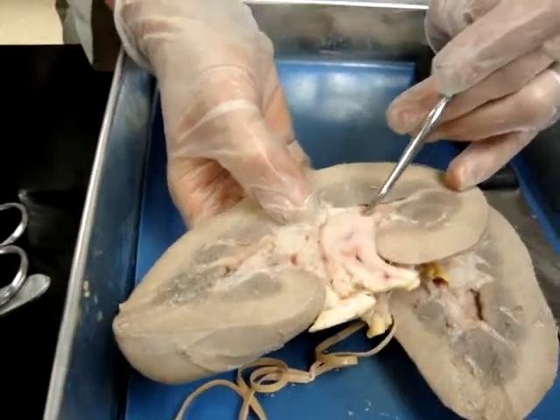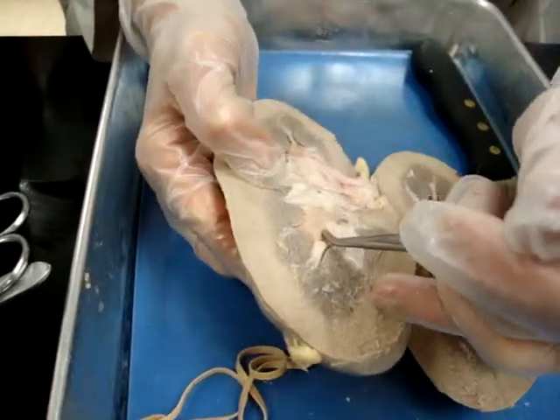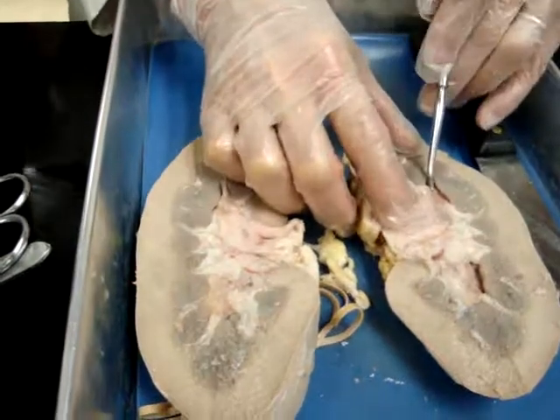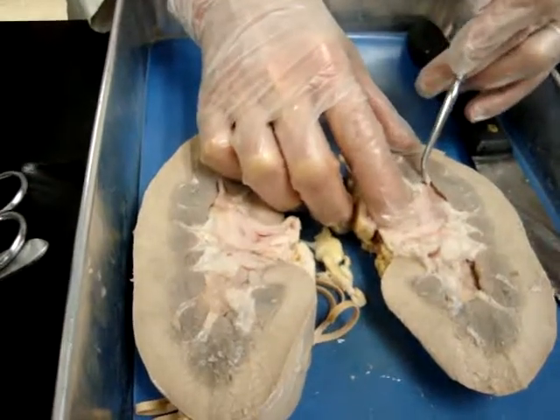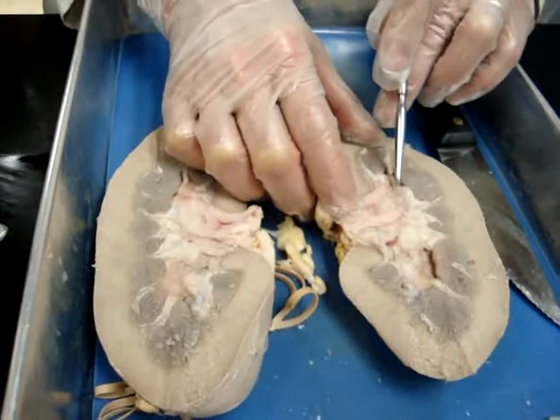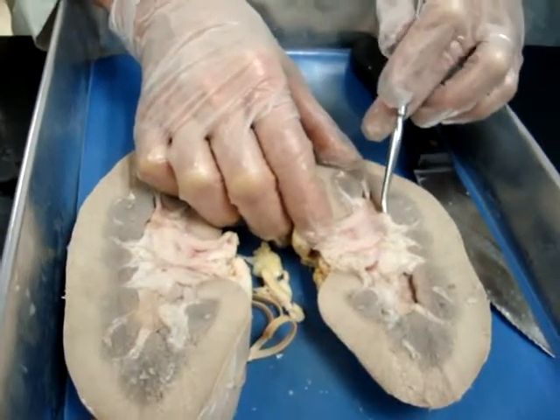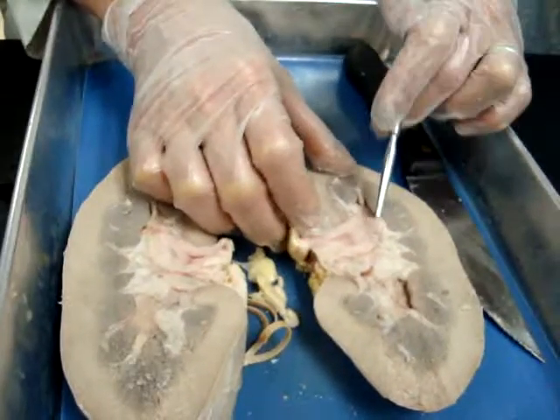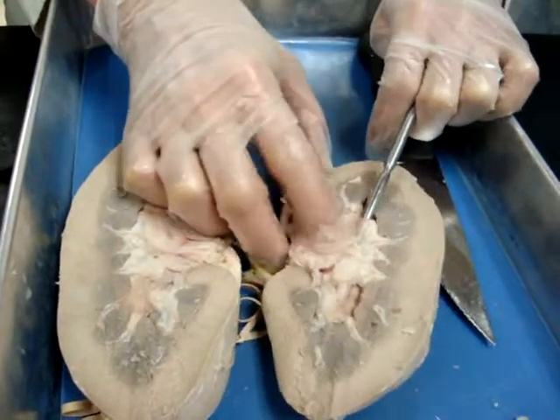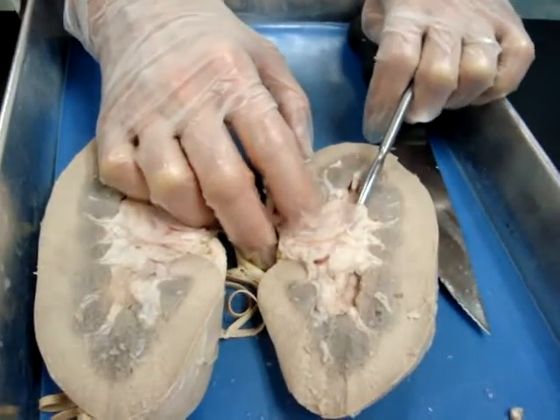So that will drain into this area here on this side. Here are my minors, and this is my major coming across — that's the major calyx. All these minors drip into it. When it gets to this point here, just before the ureter, that's the pelvis.